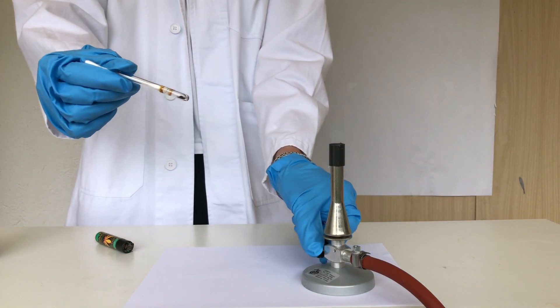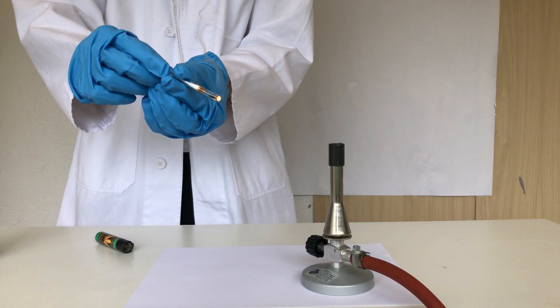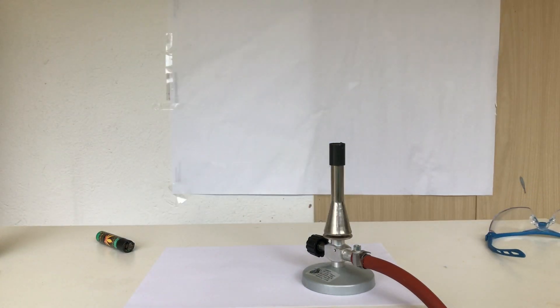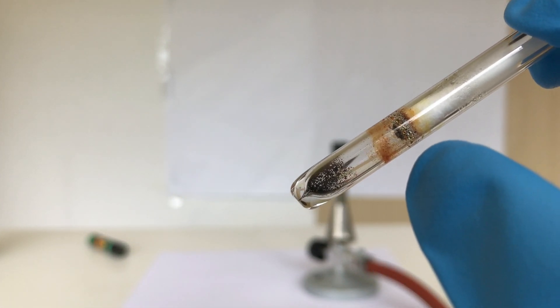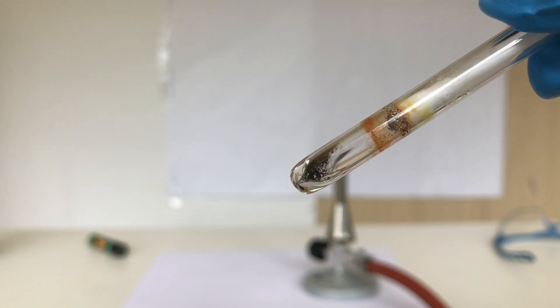The tube will fill up with yellow smoke and this smoke will settle on the wall of your test tube. My test tube unfortunately decided to crack and spread smoke everywhere. You should now be able to see a somewhat yellow precipitate that has settled on the q-tip. This is white phosphorus and it is highly toxic and flammable.